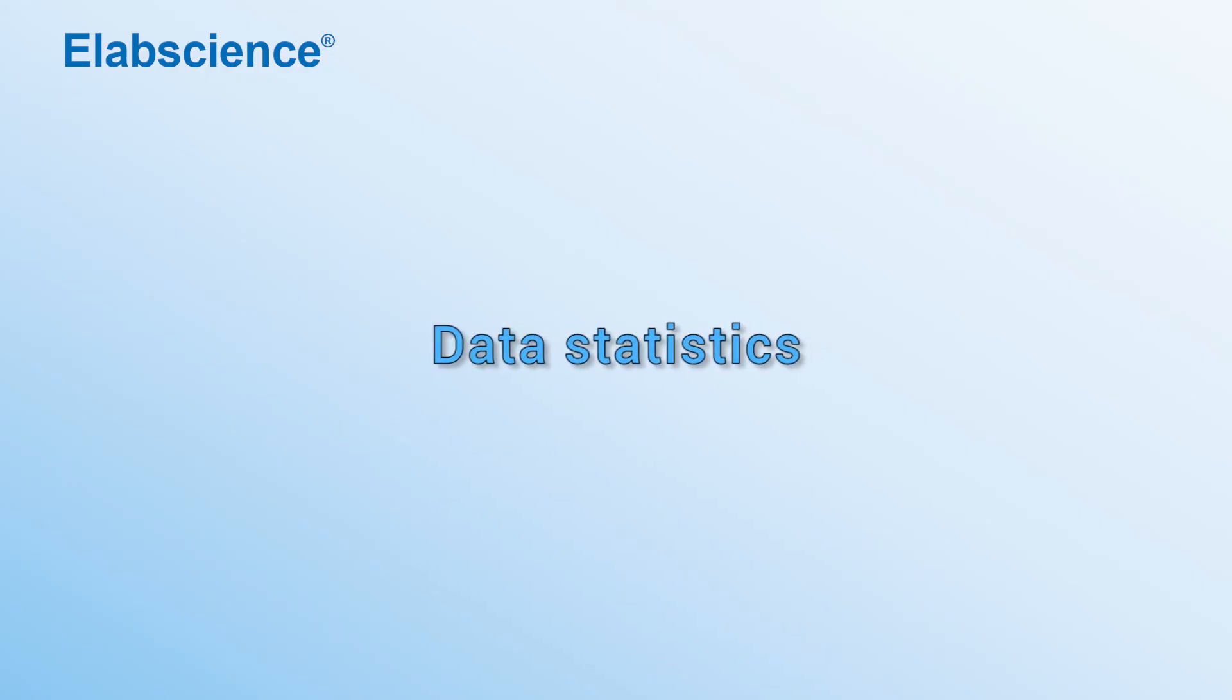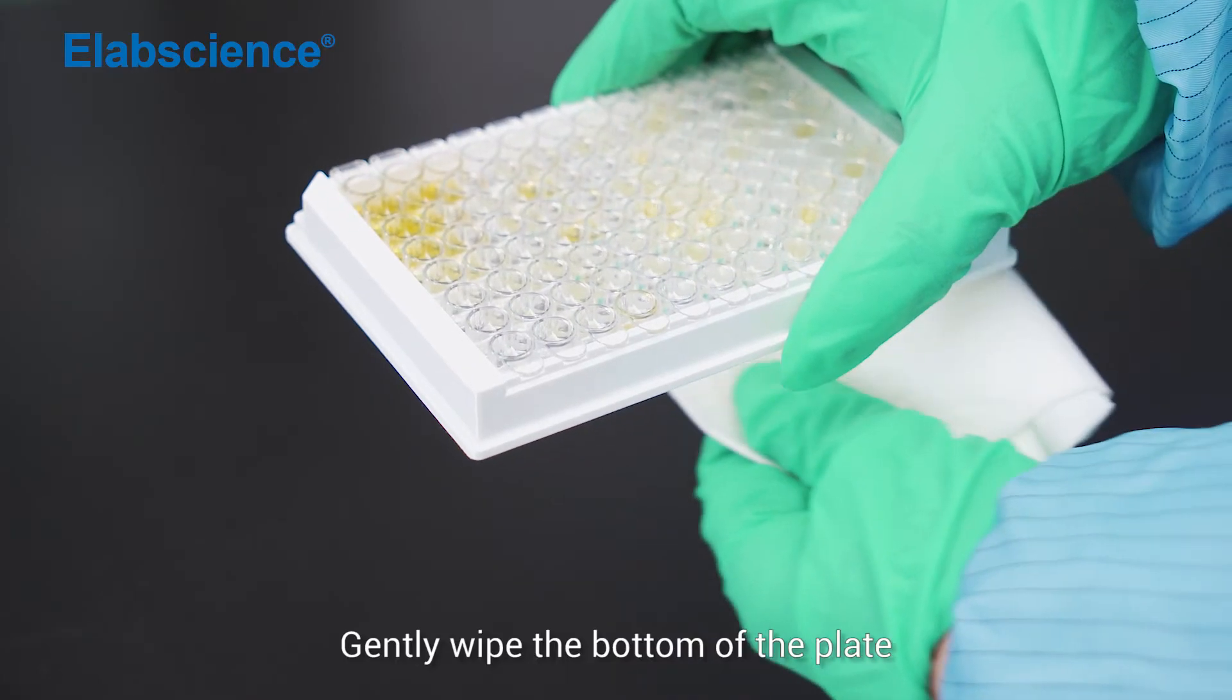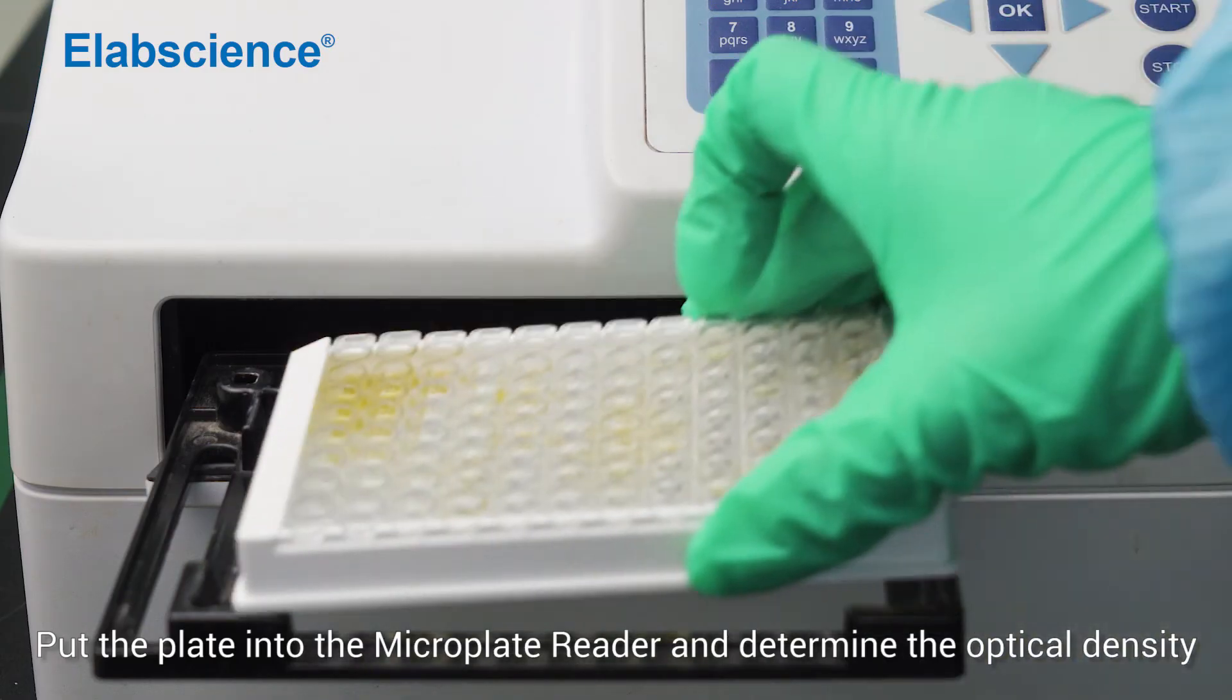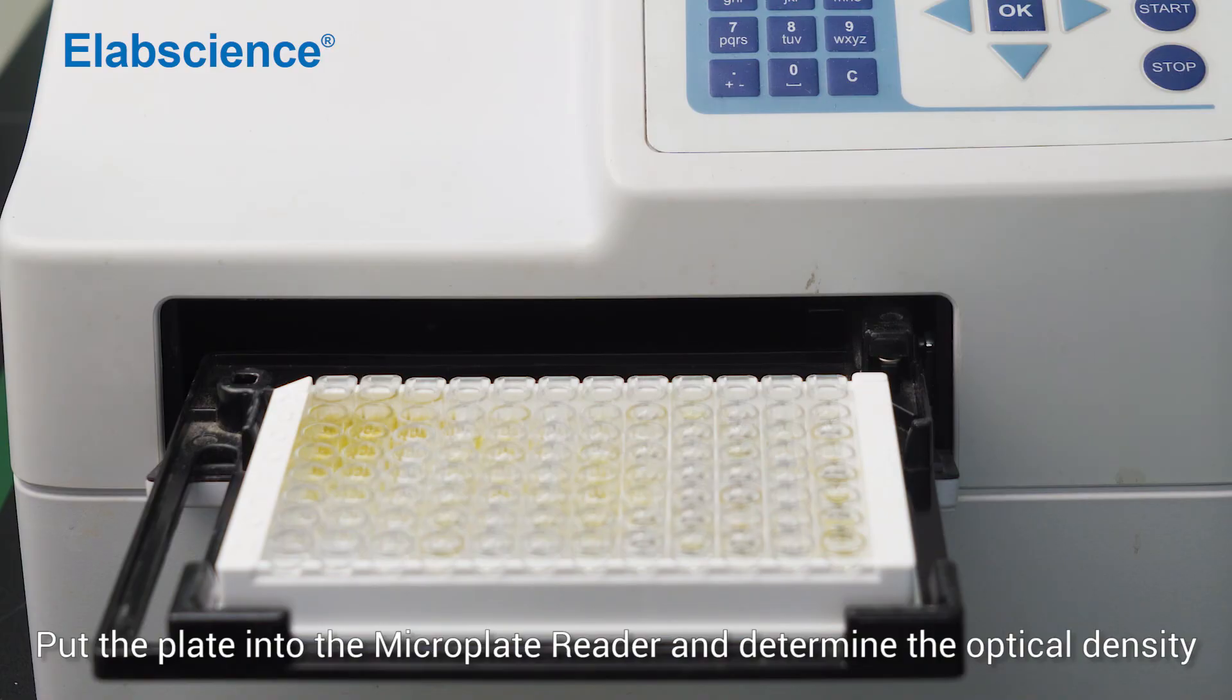Data statistic. Gently wipe the bottom of the plate. Put the plate into the microplate reader and determine the optical density.